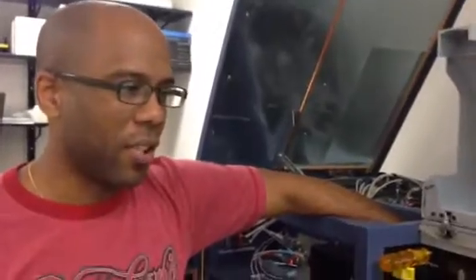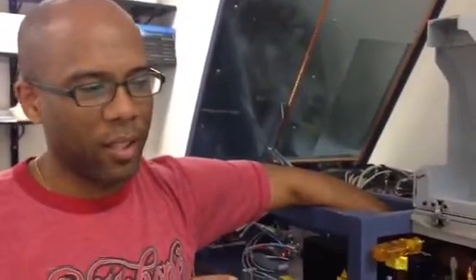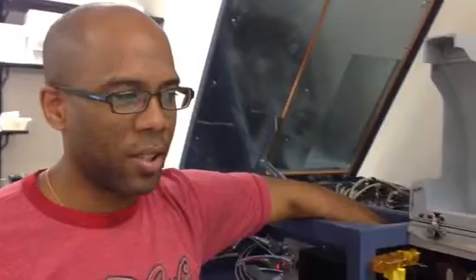Talking about was adjusting the laser to optimize the CVs on the system. The CS&T beads gave us a CV error. What the CS&T beads will not do on the Aria is make the adjustment for you to minimize that error. And the reason why we like to try and adjust the lasers to bring the CVs down is to make sure that we have the resolution on the cytometer as high as we can get it, so we can have very, very clear signal detection and separation.